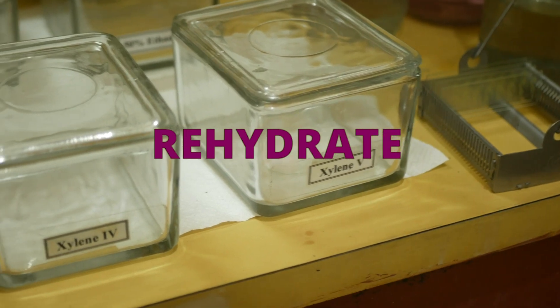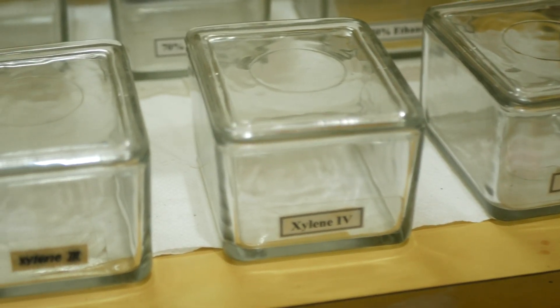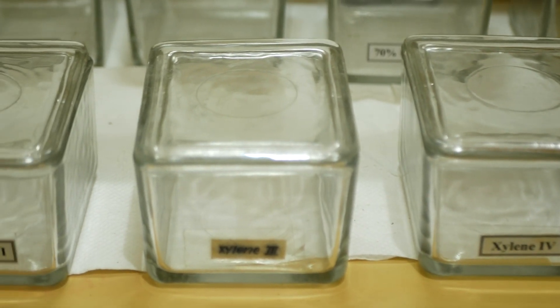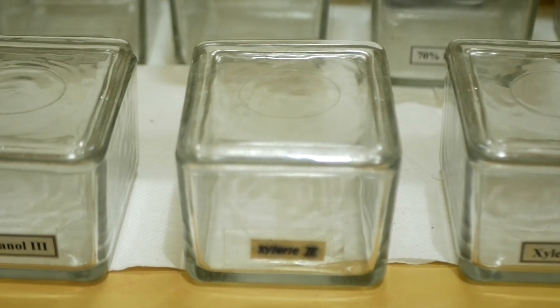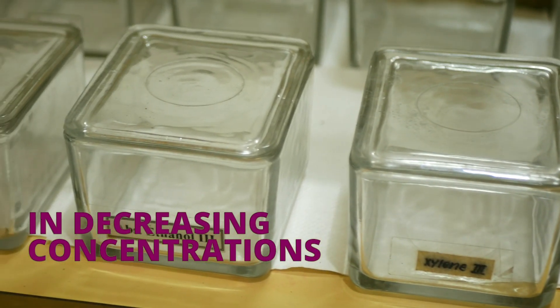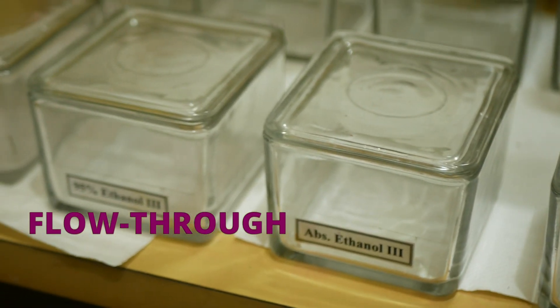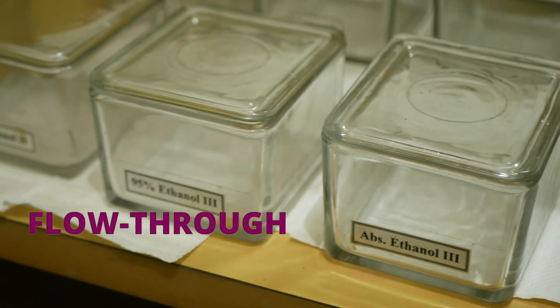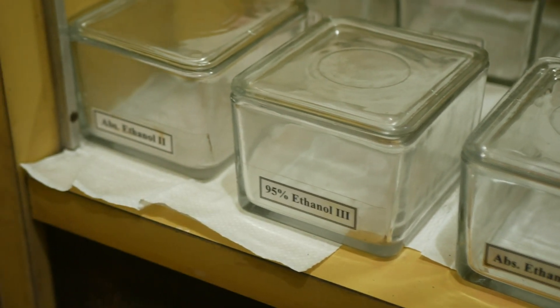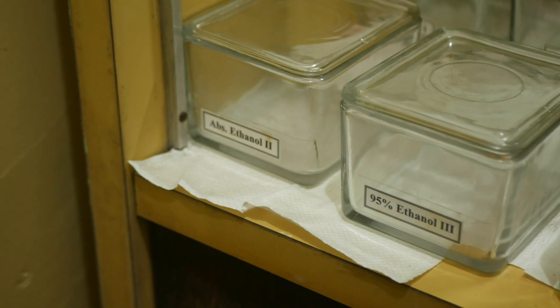Then, we rehydrate the samples. This process starts with clearing agents, making the tissues transparent, then followed by a series of alcohols in decreasing concentrations. Then, the slides are put into a flow-through using tap water to allow chemical traces and impurities in the slides to flow off. Finally, the slides are dipped in distilled water.